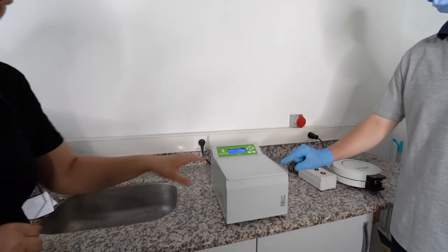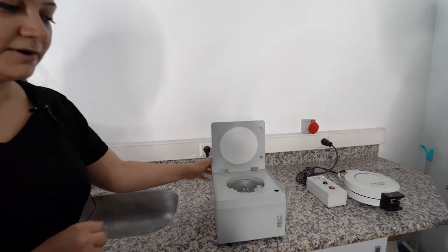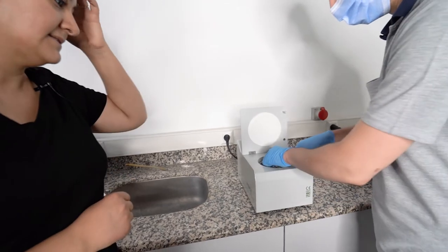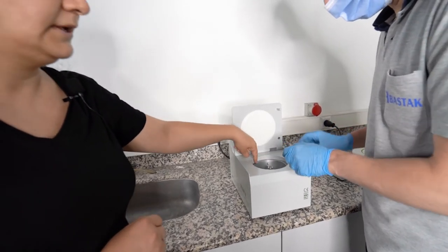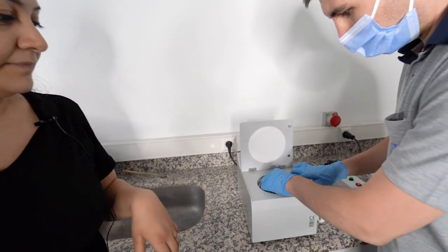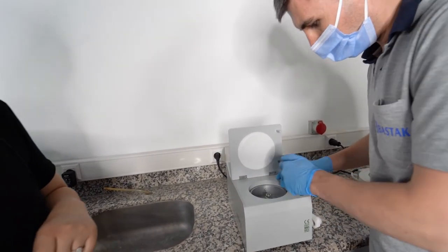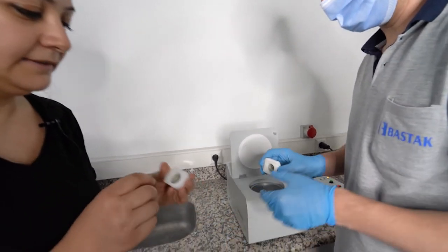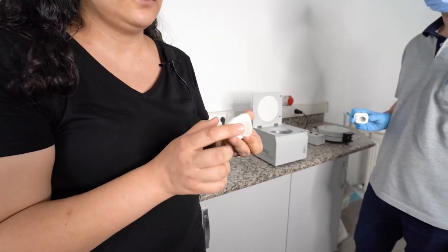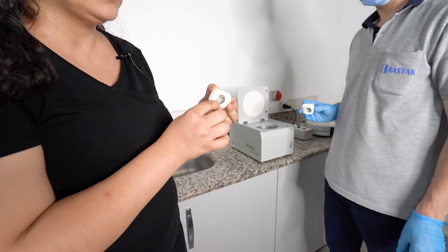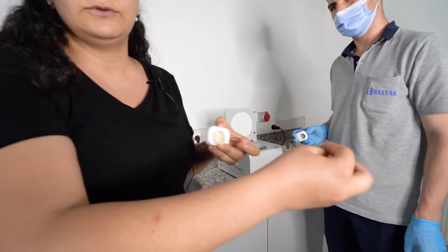Now it's warning and there is security on the door. You cannot open without warning. Now we will see the test results. You should check around the display if there is any sample here. Sometimes it is sticking. Here there is a sample, little pot. We are saying that this side is the weak gluten and this side is the strong gluten, strong wet gluten. We should remove first the weak gluten, otherwise if you start to take this one, all sample will go this way.